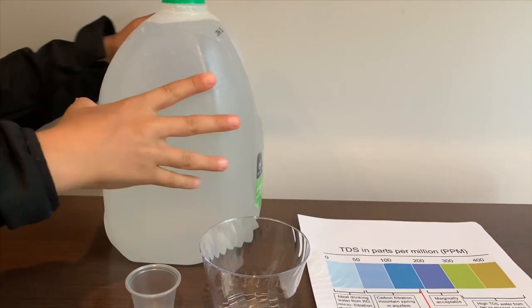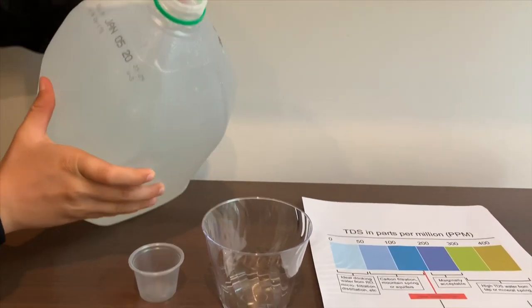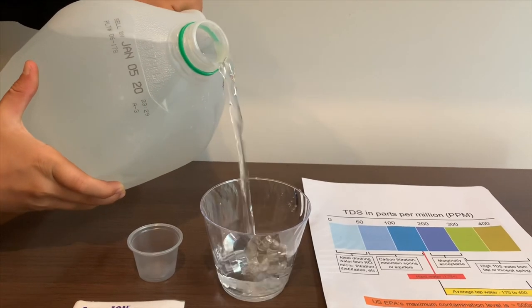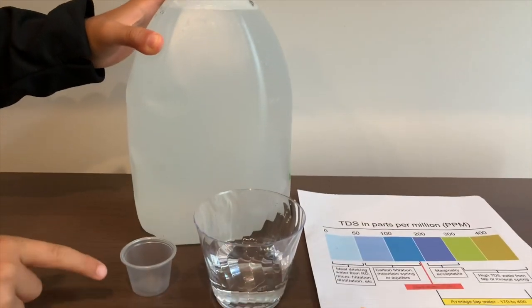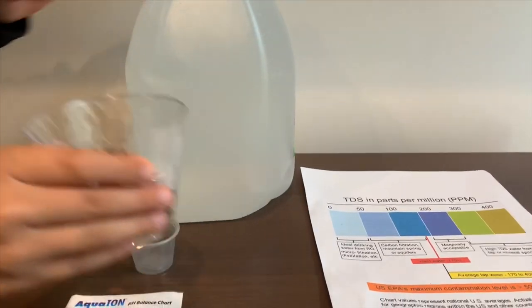Let's pour some water in. This cup and this bottle is too big to pour in here, so I'm going to use the TDS cup.